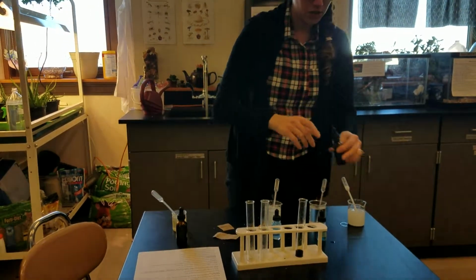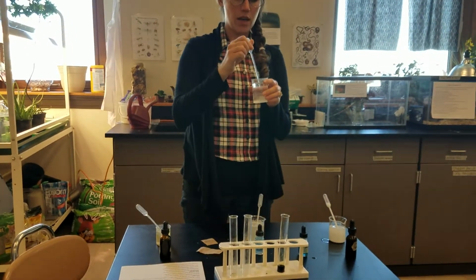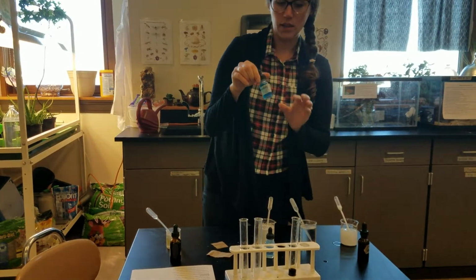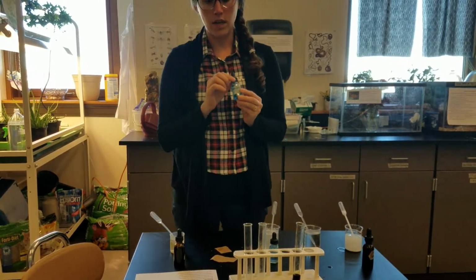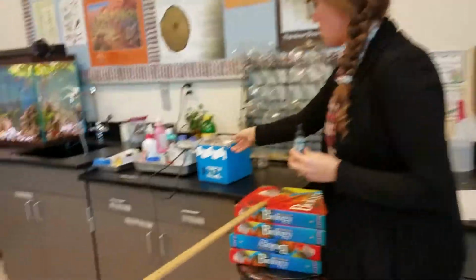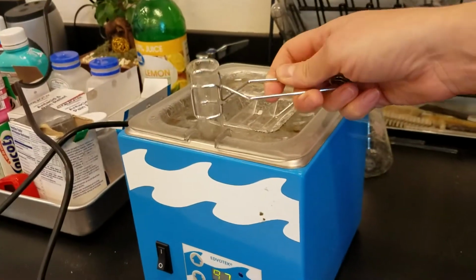The next solution is glucose, which is sugar. So I went ahead and put some sugar in a test tube, and we use Benedict's. And you'll notice on there it says you need to put it in a water bath. That means you're going to boil it and add some heat. So I have it with some tongs here so you don't burn yourself. This is almost 100 degrees Celsius, so it's pretty much boiling.